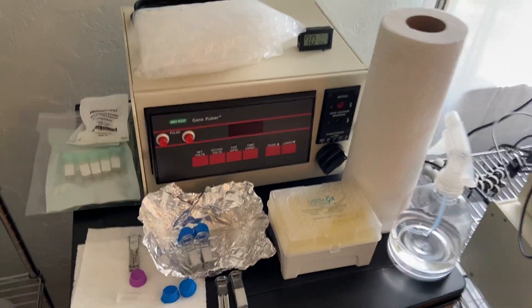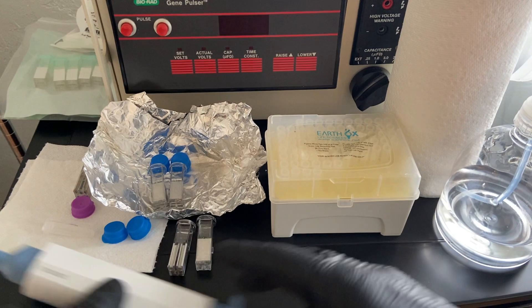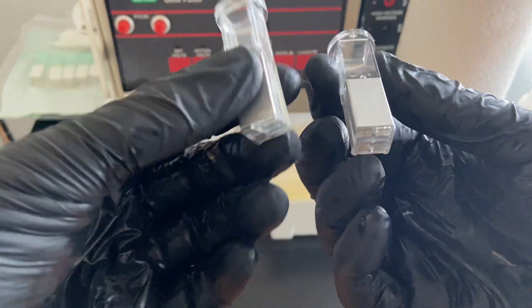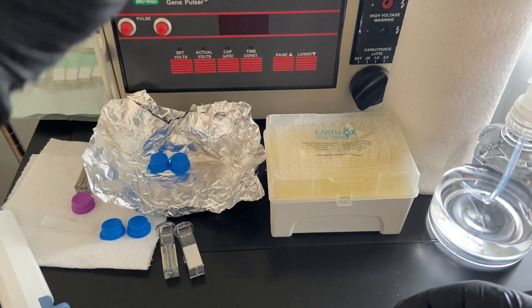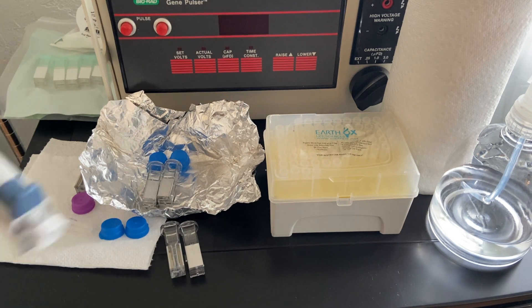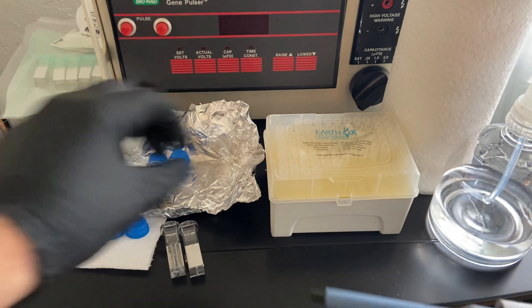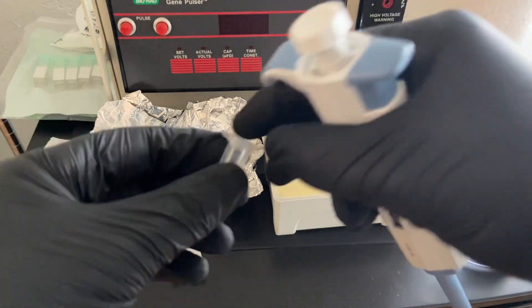The machine is set up and my work area is on top of the refrigerator. I have some alcohol to sterilize hands, some used cuvettes from the last video — some more used than others — and my pipetter set to 40 microliters, and the bacterial suspension right here. Let's go ahead and load up a couple of these cuvettes and give them a shock to see how it goes.